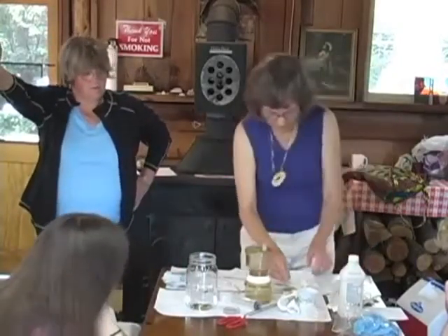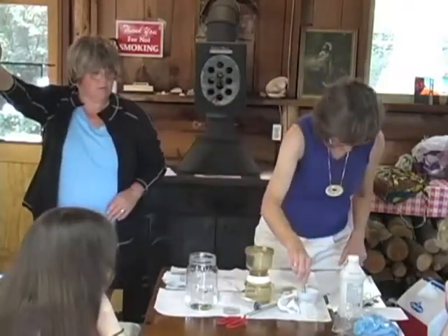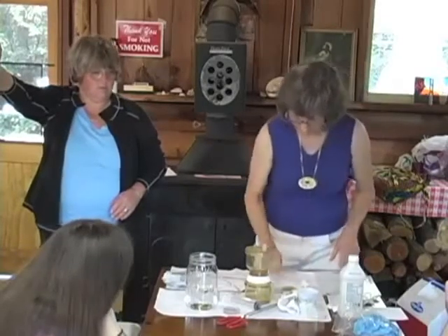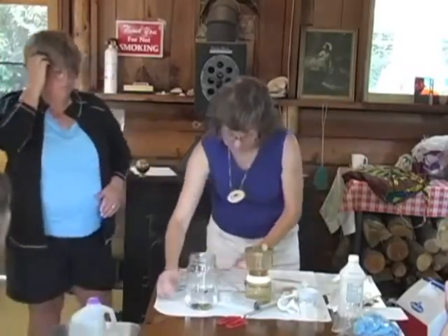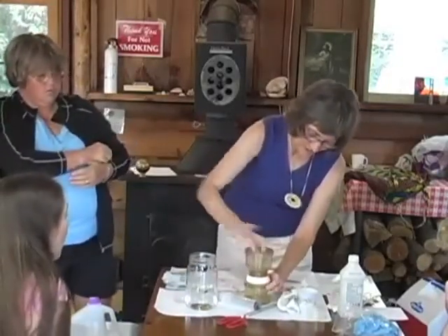Re-sanitize the forceps with alcohol and flame. I've got a new sanitized one here. Okay. Unscrew the top half of the unit and open the petri dish. So open the petri dish. Unscrew the unit. White ring. That's right, the whole thing is attached.